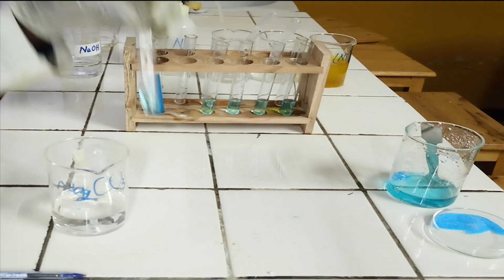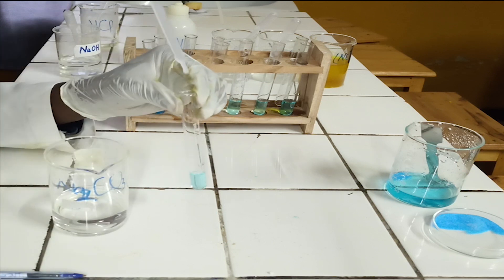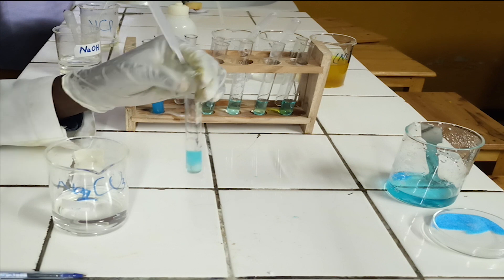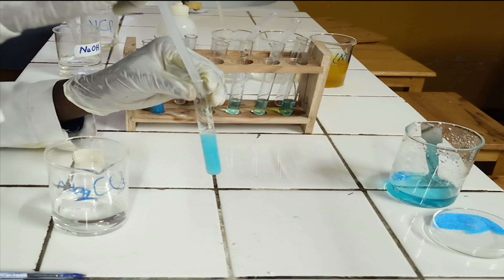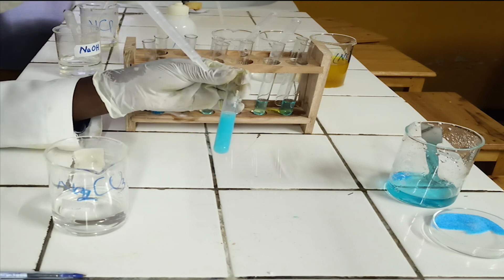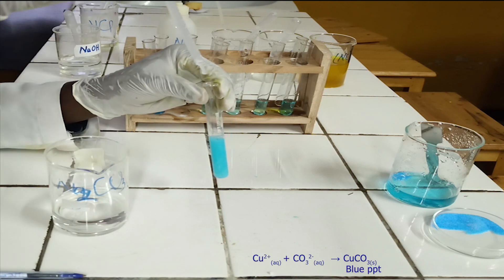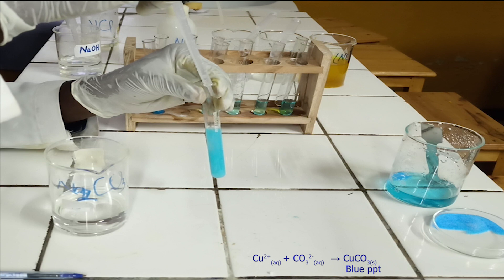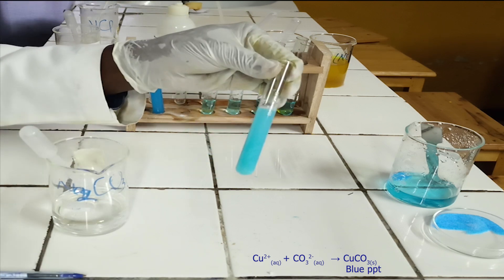To the second test tube, add sodium carbonate solution dropwise until in excess. As you see, sodium carbonate reacts with copper-2-ion to form a blue precipitate, which is insoluble in excess of sodium carbonate. Below, there is the ionic equation for this reaction.